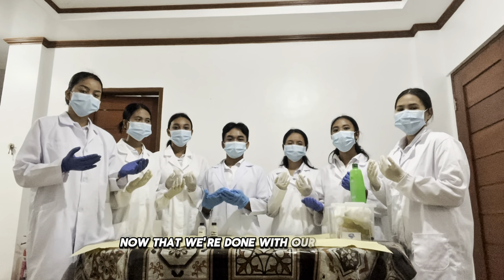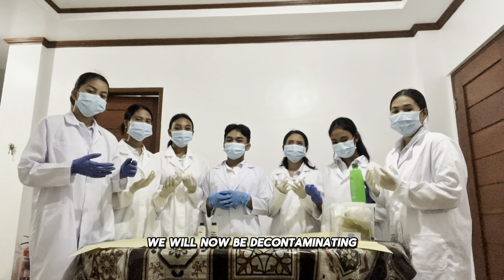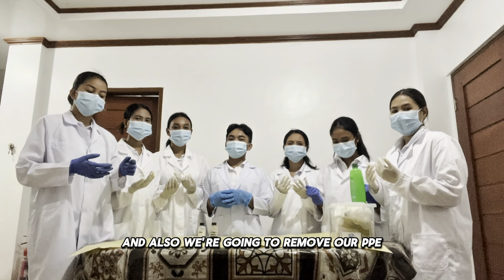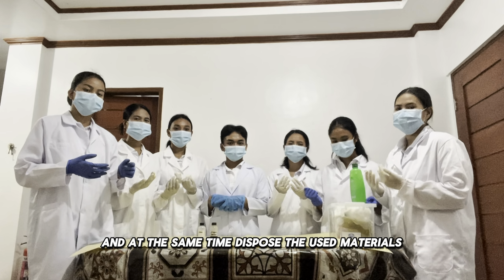Now that we're done with our procedure, as the last step of our return demonstration, we will now be decontaminating our working area, and also we're going to remove our PPE and at the same time dispose of the used materials.